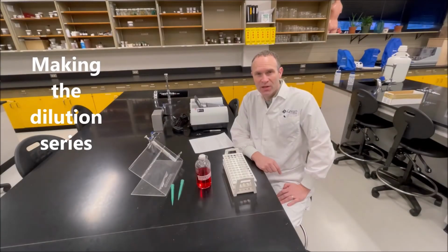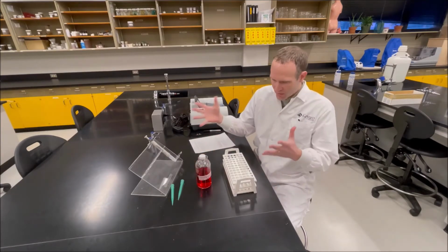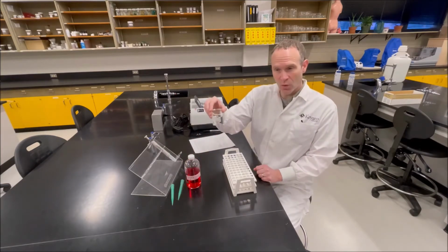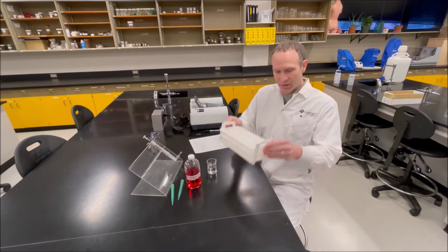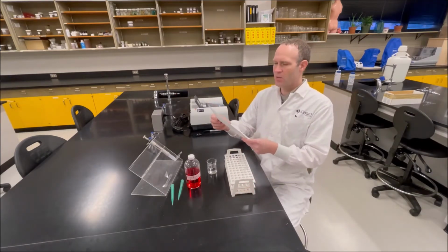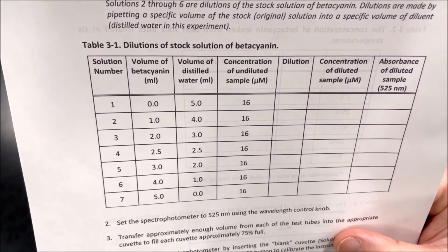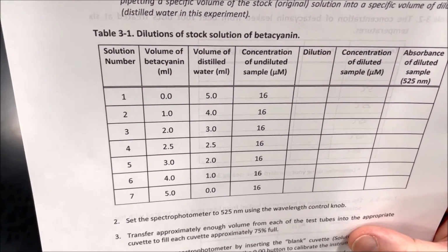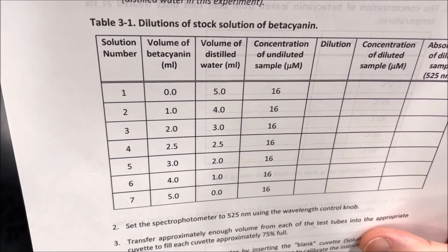The first thing that we need to do for this lab is to make a dilution series of beta-cyanine. I think I have everything I need to do this. I have some beta-cyanine, some distilled water, a micropipetter, which I'll get to in a minute, some test tubes, and table 3-1. Table 3-1 shows me the volumes that I need of water and beta-cyanine for these 7 test tubes. For test tube number 1, I need 5 milliliters of water, so let's do that right now.